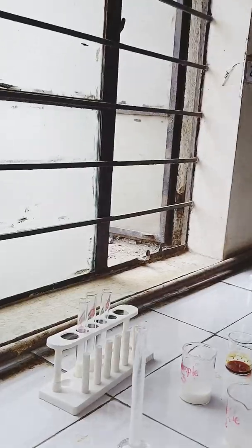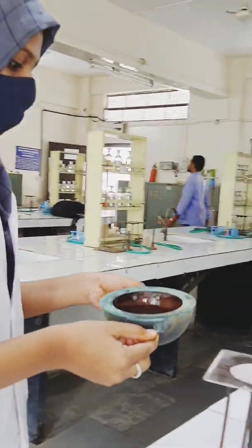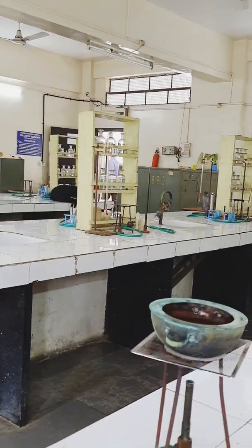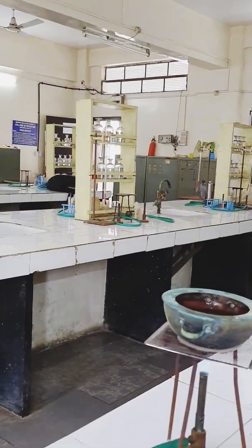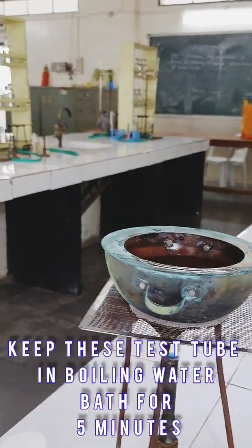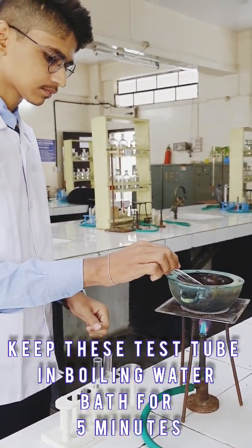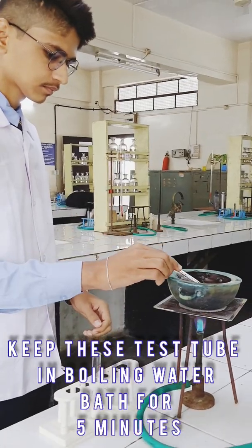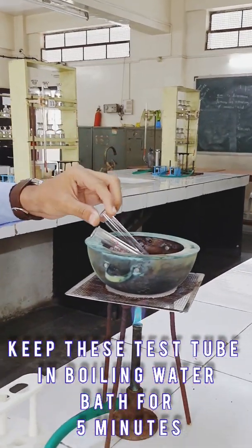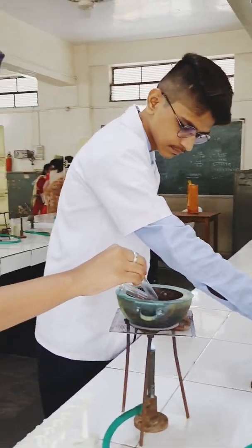Next, keep all these test tubes for incubation in a boiling water bath for 5 minutes. One by one, keep all the test tubes in the water bath. After incubation, cool the test tubes.